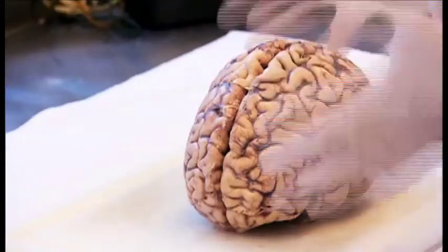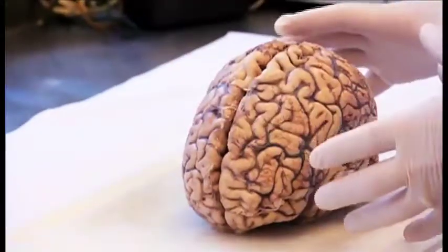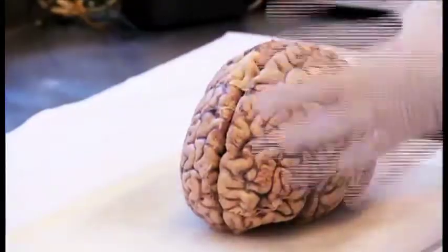We look at the brain, we'll feel it for areas of softening, we look for signs of asymmetry, we look for signs of atrophy.